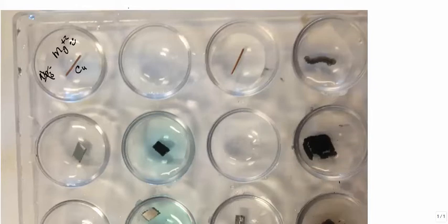Copper is a very grumpy, solid piece right here. It has a 0 charge, it has all its electrons, and it desperately wants to give up its 2 electrons. It wants to reduce somebody. Unfortunately, for copper, magnesium is the wrong person to try to reduce. Notice that nothing happened. So what does that mean? That means that magnesium is more active than copper.